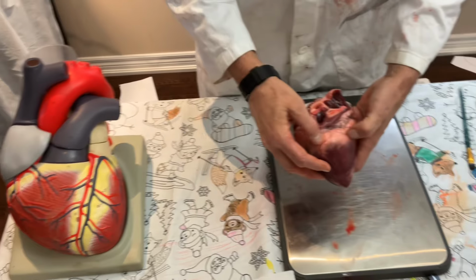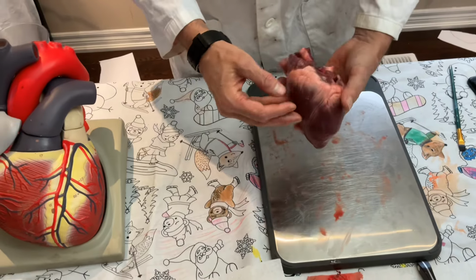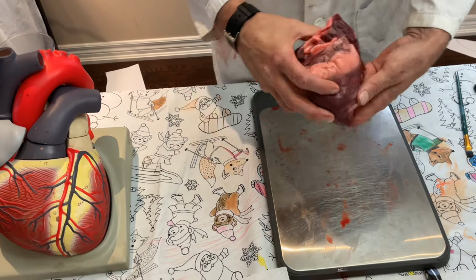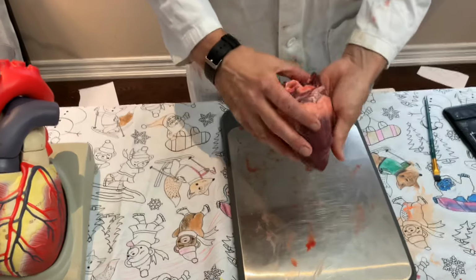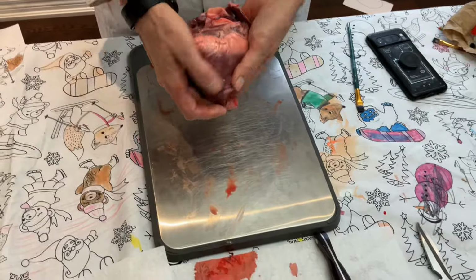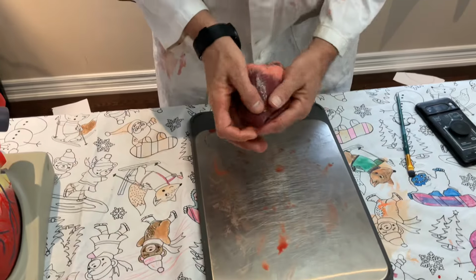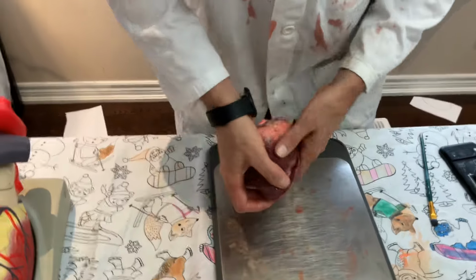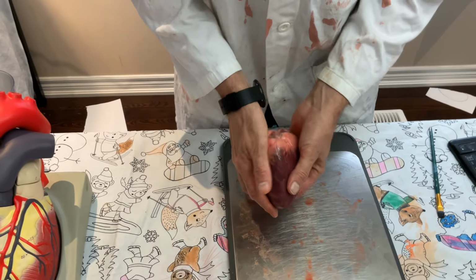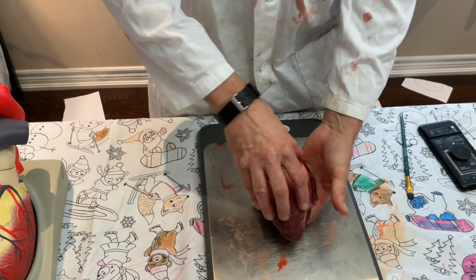Now, this stuff on the surface, this white stuff, is fat. And it actually pads the heart. So we need to have a little layer of fat on the surface of our heart. And they've actually cut open the pig's heart already, so that's been done for us. You can see this is the base. The apex here is a little bit pointy. Here, let me line it up so you can see how it was. It's a little bit pointy at the bottom, but rounded. And let's open it up and look inside.